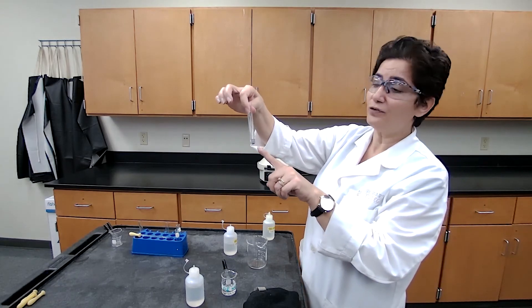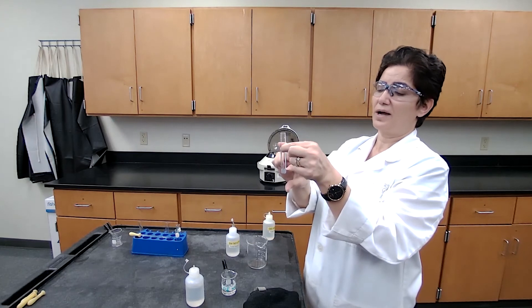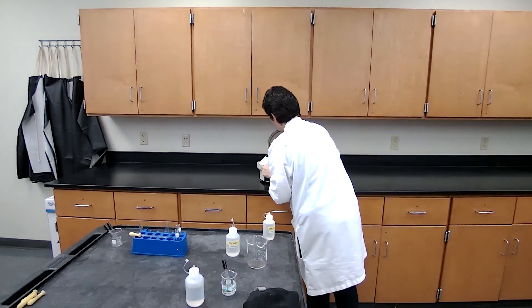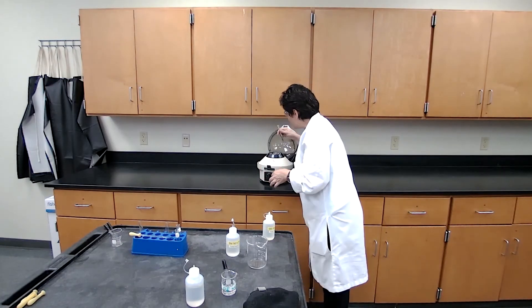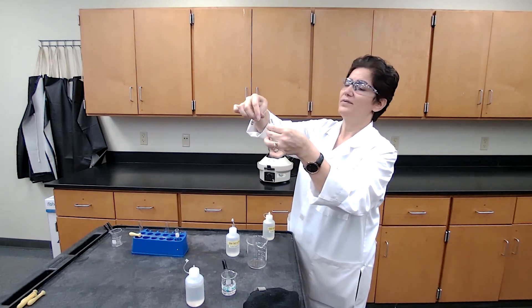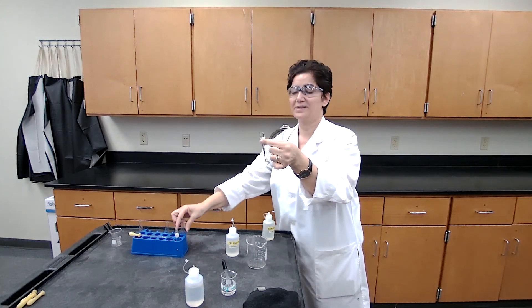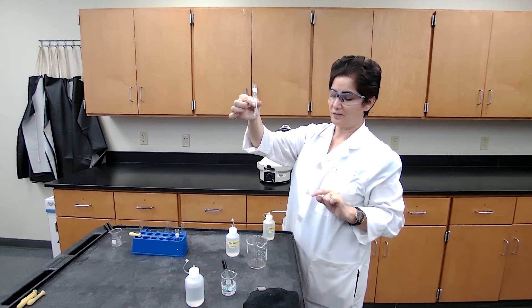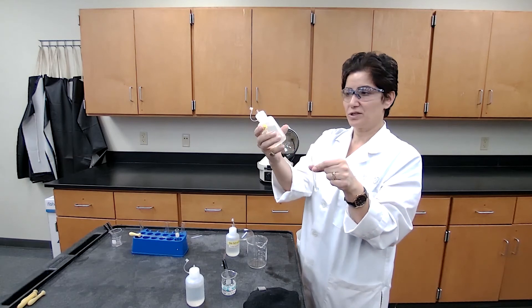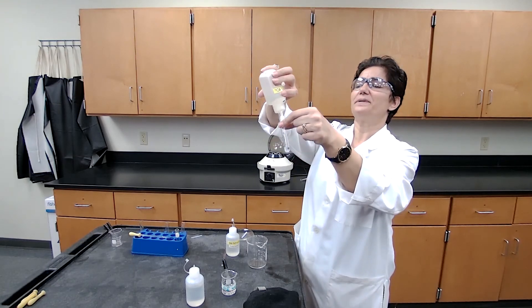For the next step, we need to centrifuge because silver ion dissolves when we add ammonia, so the solution contains silver ion. We centrifuge and test the clear solution for the presence of silver. After centrifuge, I take the test tube out and separate the centrifugate, which is expected to contain silver ion, into a labeled test tube. To the centrifugate, I'm adding 6 molar HNO₃ following the procedure until the solution is acidic.